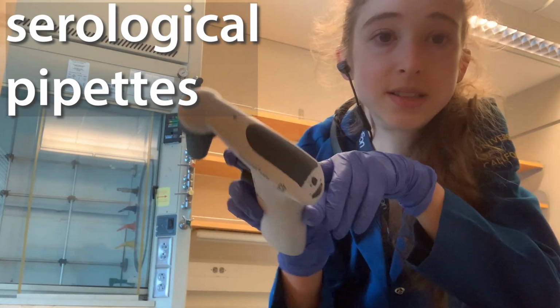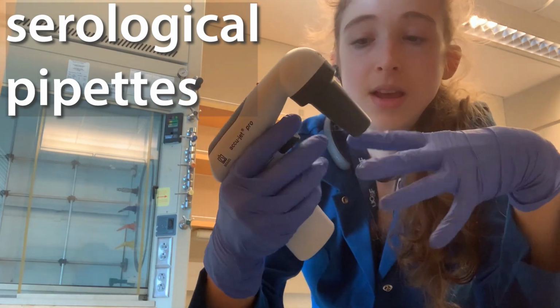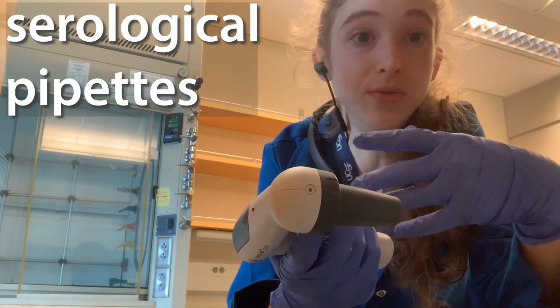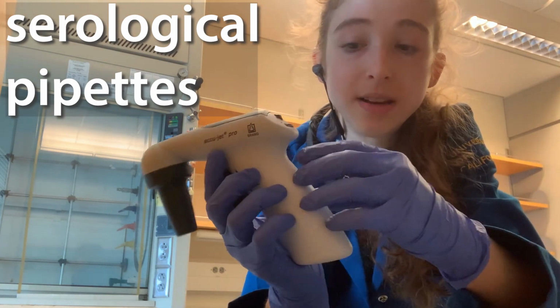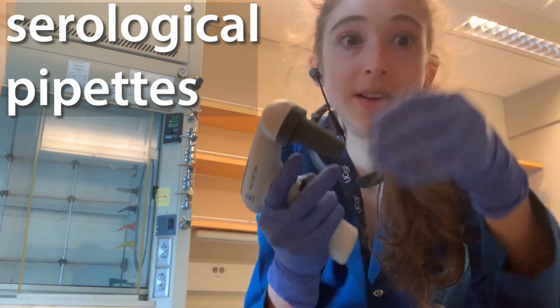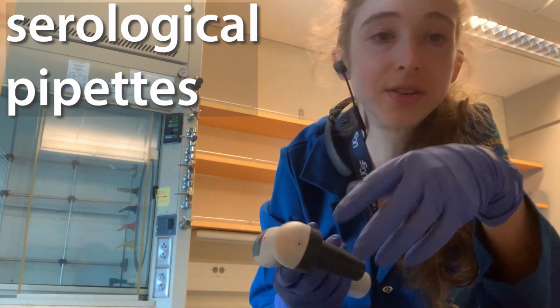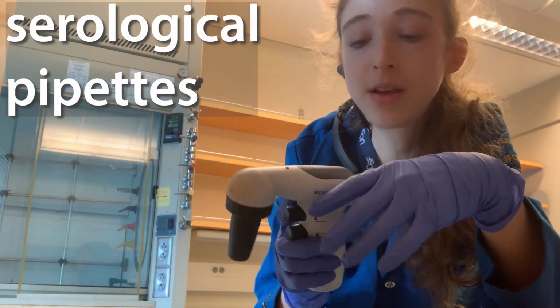Some of these are fancy, and you can set them to have different speeds. This is really, really important, especially with cell culture, that you're not going too fast and killing all your cells. So you can set the speeds for the up and the down. For coming up, you might want to go faster. When you're coming down, you want to go slower, because you don't want to kill your cells. But when you're going up, you don't want to spend forever pipetting up all of that media, the food that you want to feed your cells.